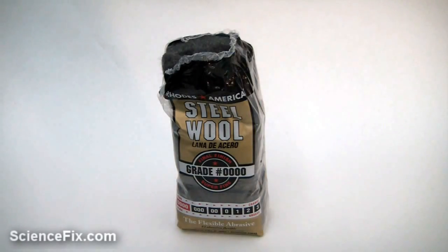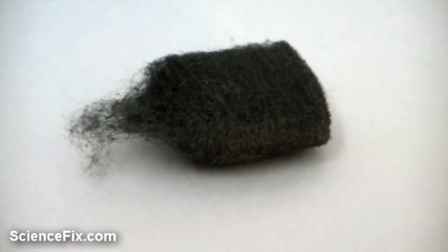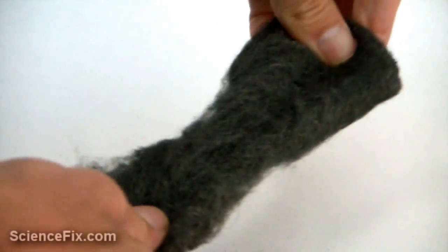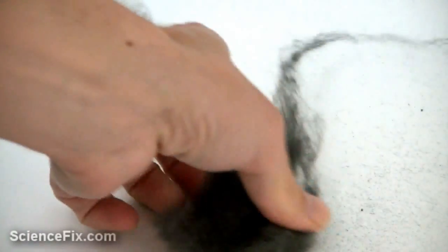You're looking at steel wool. The primary element that steel wool is made out of is iron. The properties include a gray metallic color, very thin fibers, and somewhat a rough surface.